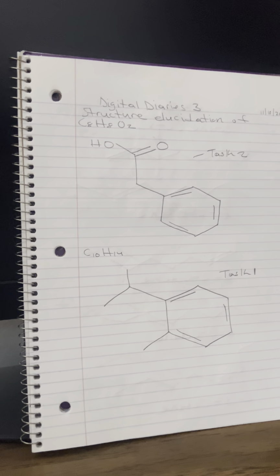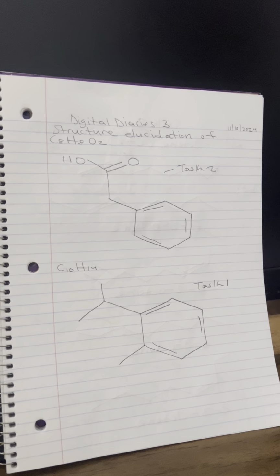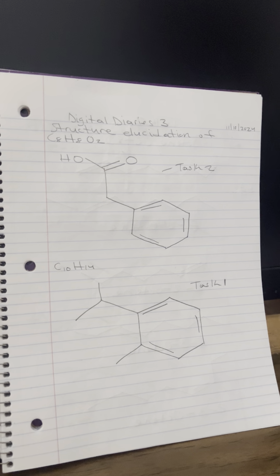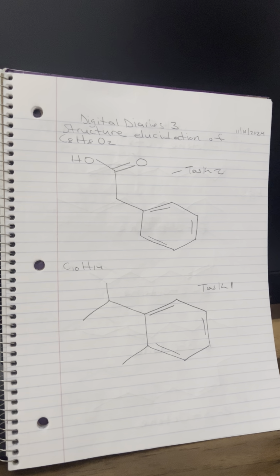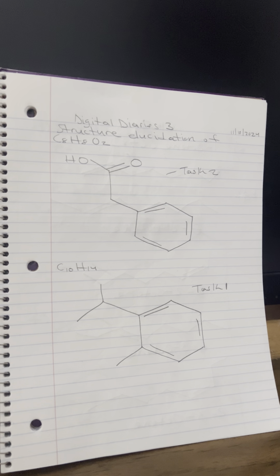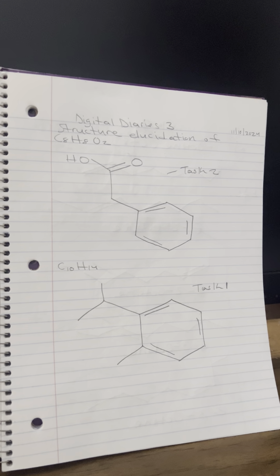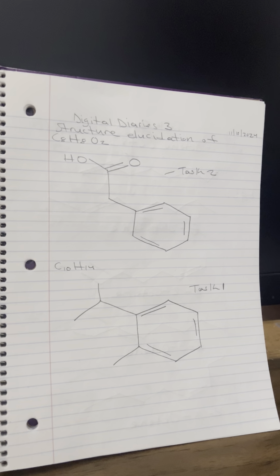Then 10 divided by 2 gives you 5. The aromatic regions are 7.78, 7.22, and 7.11 ppm. And the peak suggests a CH2 or OCH3 group attached to an oxygen or electronegative atom at 3.58 ppm. And yeah, I already explained everything.